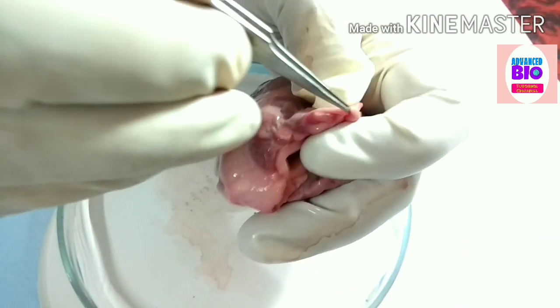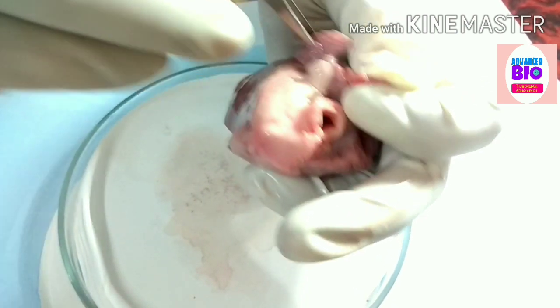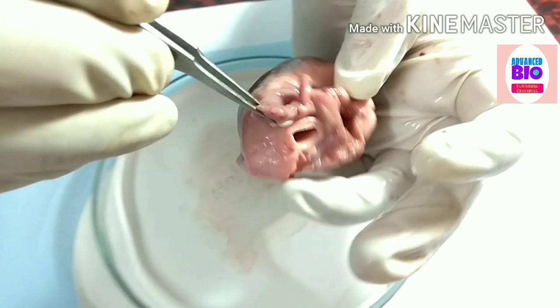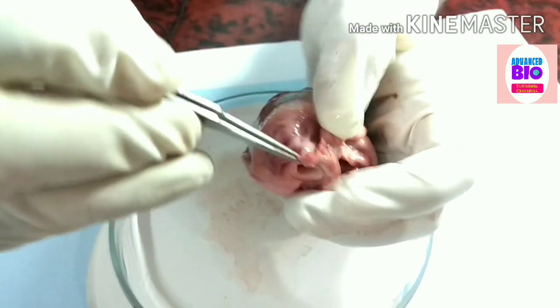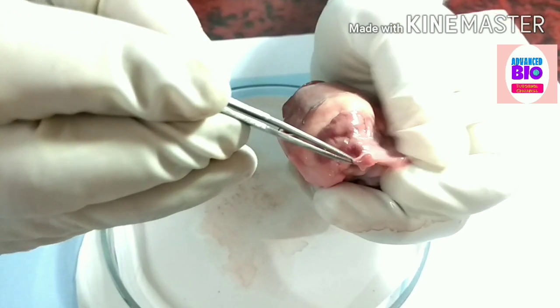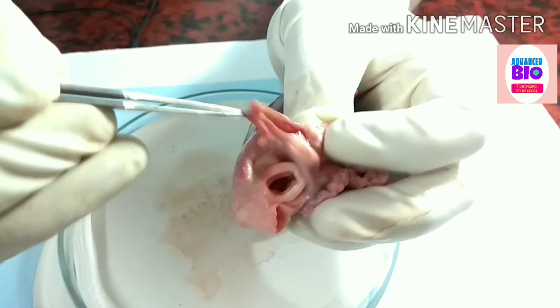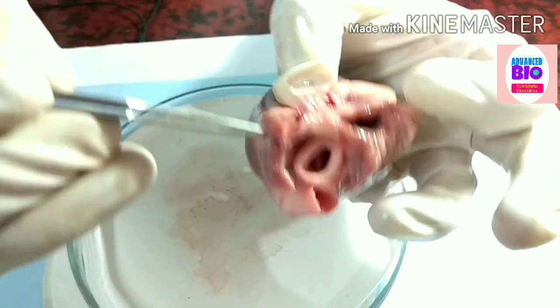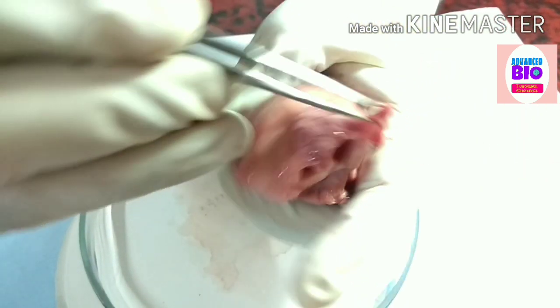The atrium is closed — I have to rupture this. This is the atrium. See this one — this is the superior vena cava.